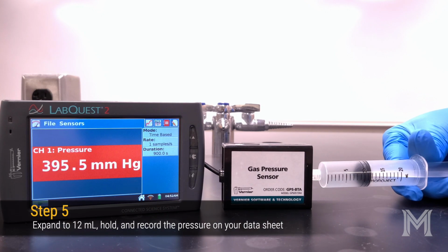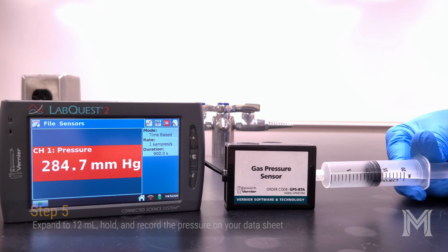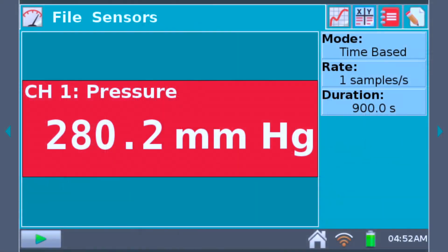For your third data point, pull your plunger out to a volume of 12 milliliters and hold while you wait for the pressure to stabilize. Once the pressure reading looks stable, record the value on your data sheet.